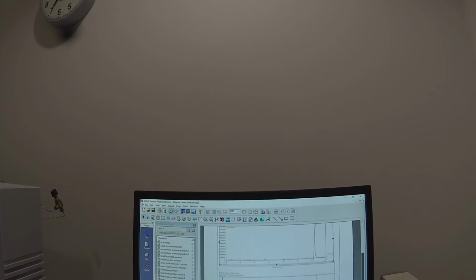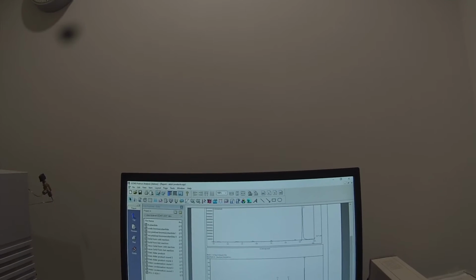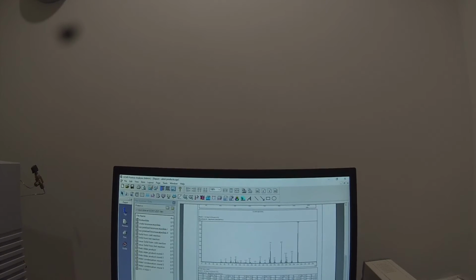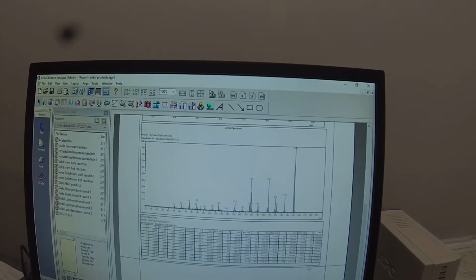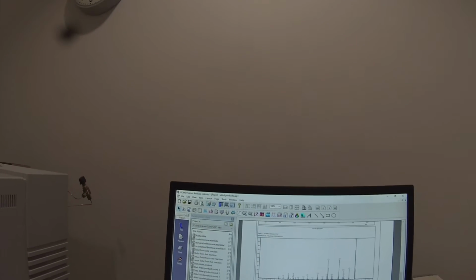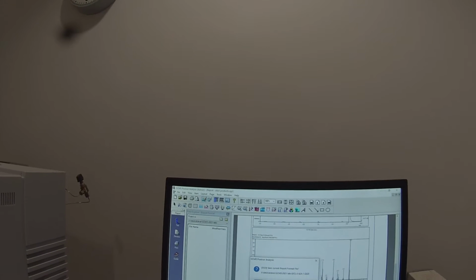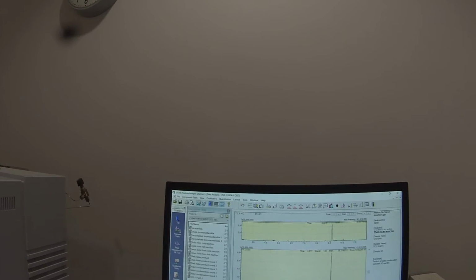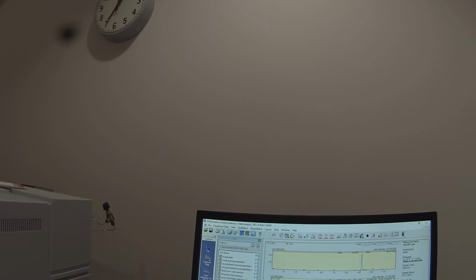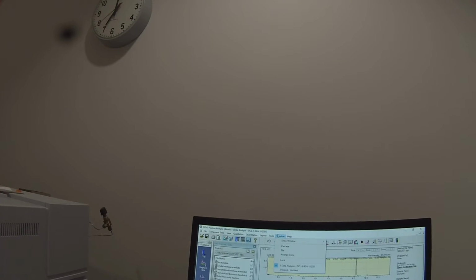and there is our mass spectrum, this big peak at 250, and we've got our table of results. And it looks like we're picking up a whole bunch of peaks with very small relative intensities. I would like to make that stop. And there's a place to do that. I'm going to save that report format. There's a place to do that if I can find it. But I always have trouble remembering where that is.